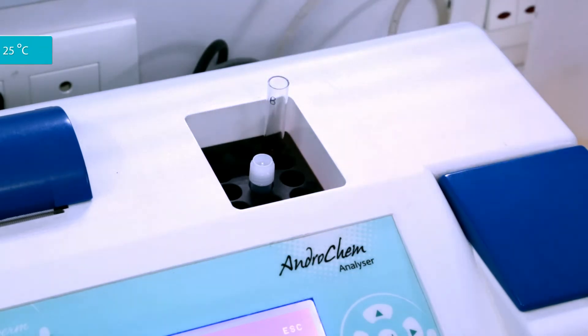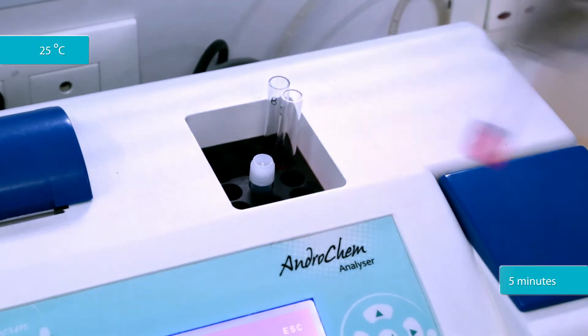Incubate all the tubes at 25 degrees Celsius for 5 minutes.